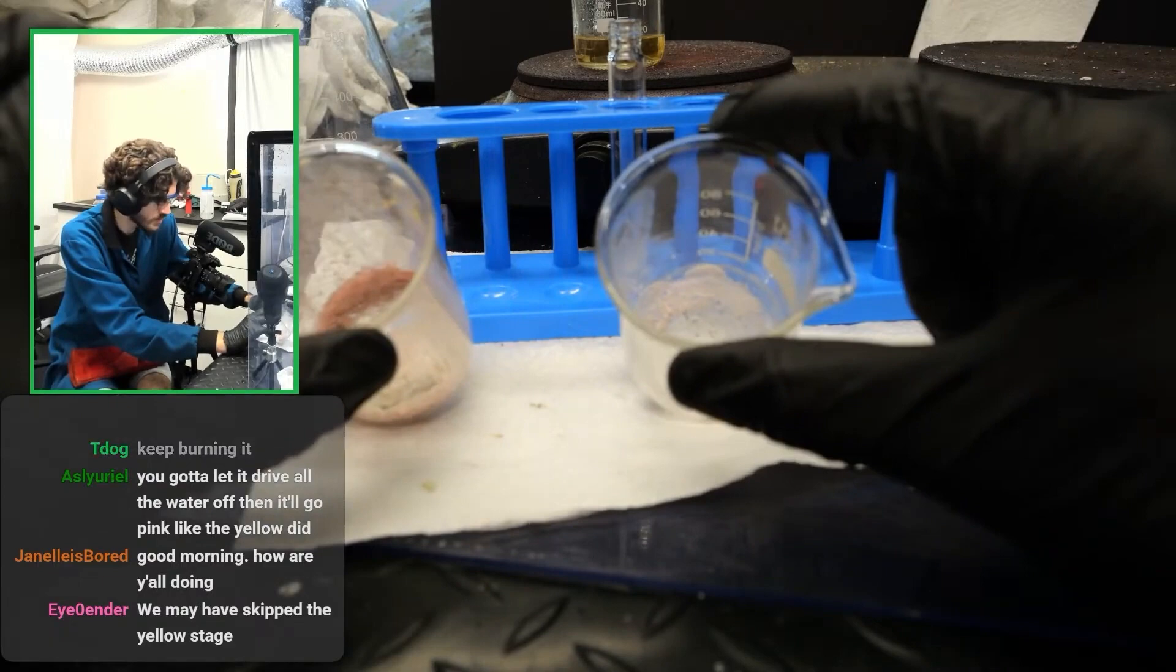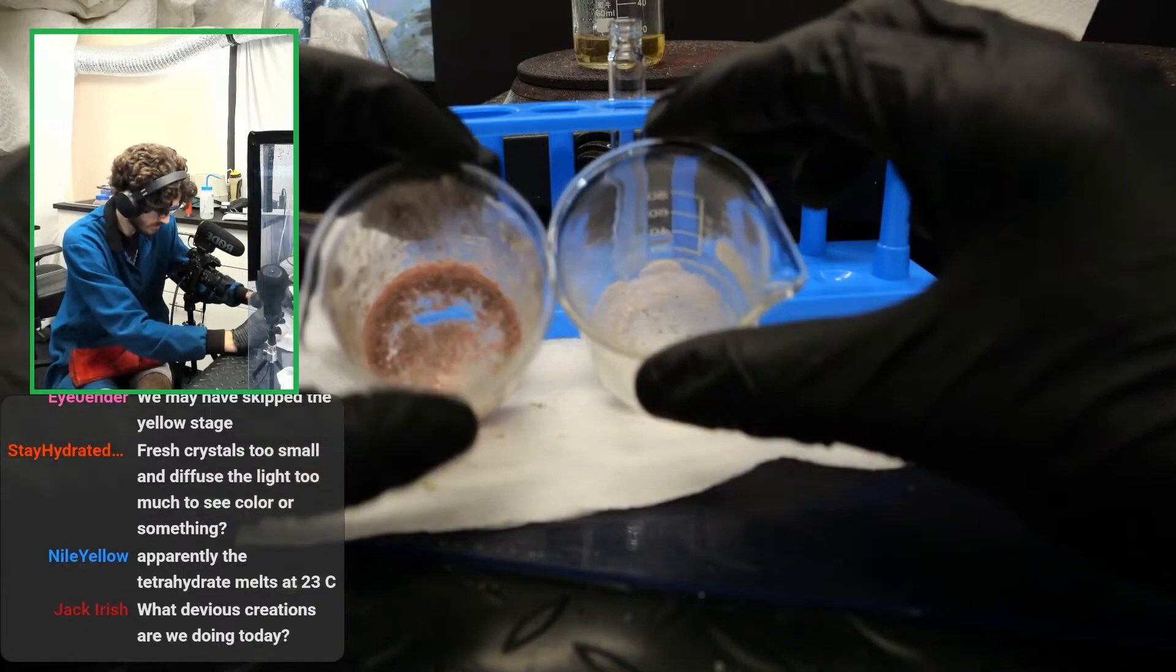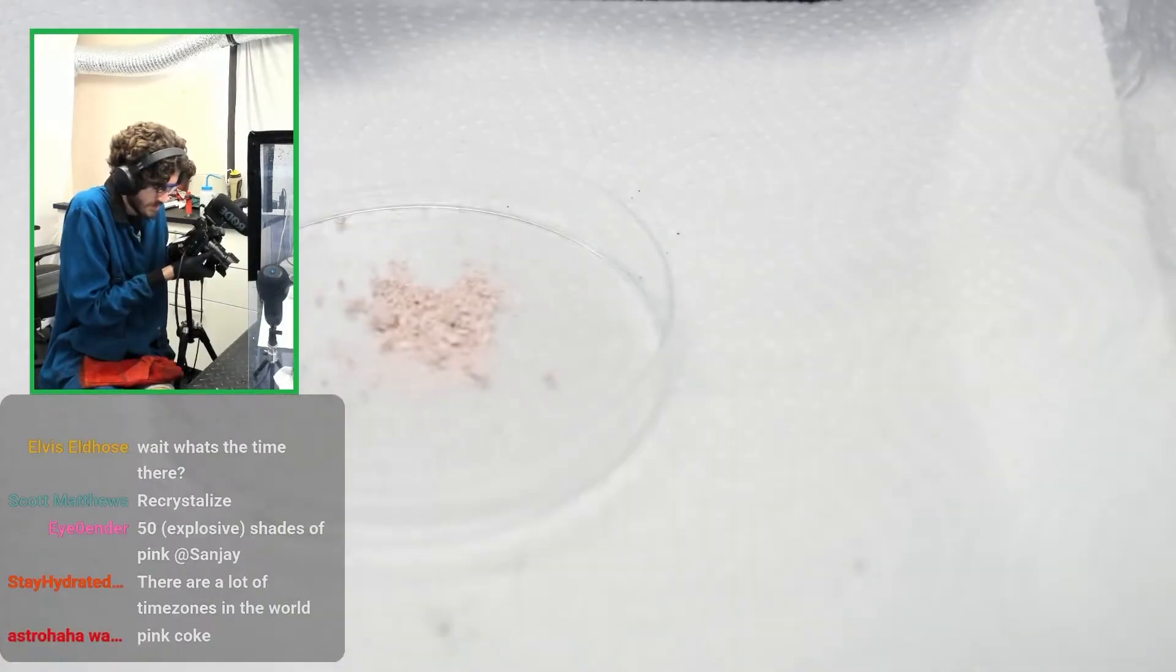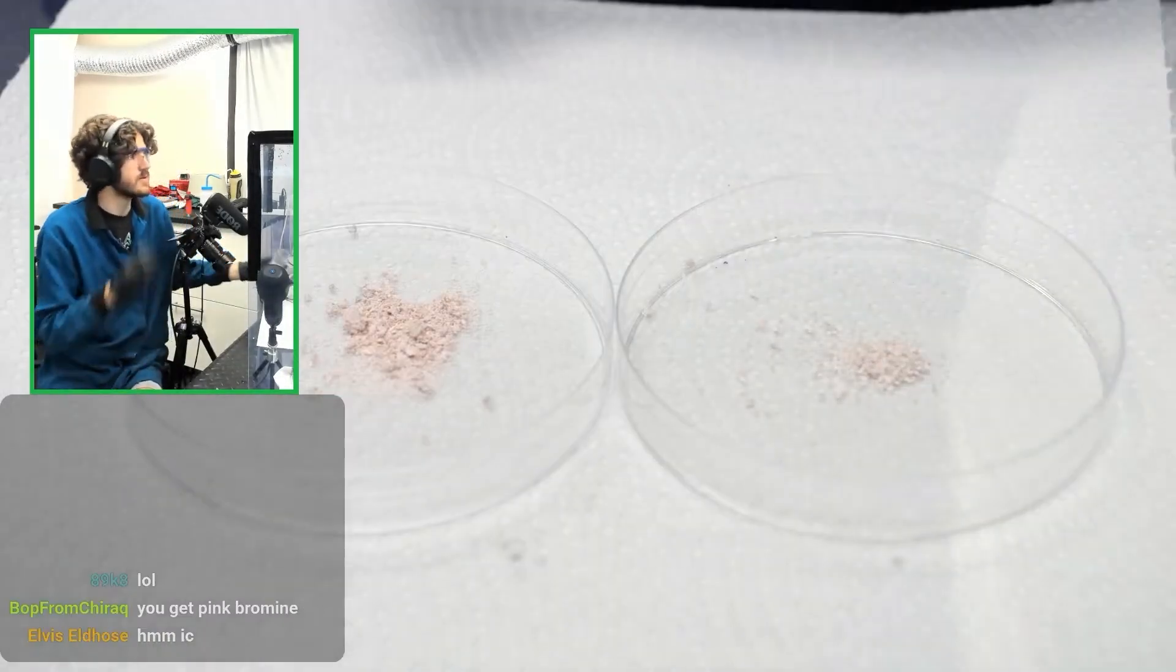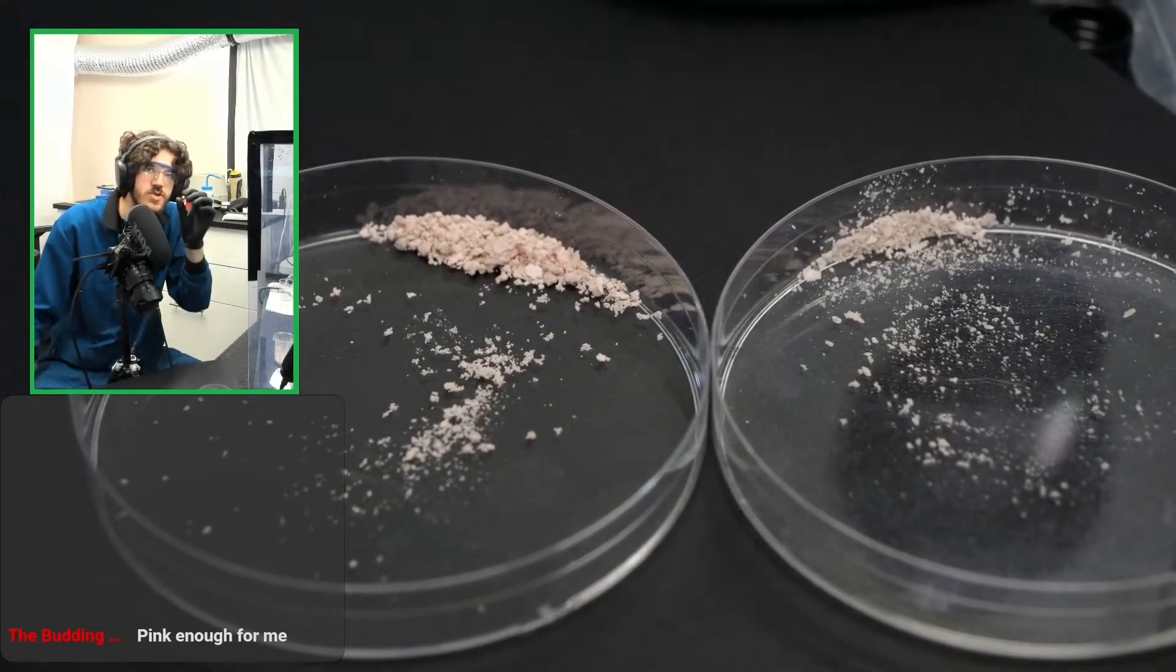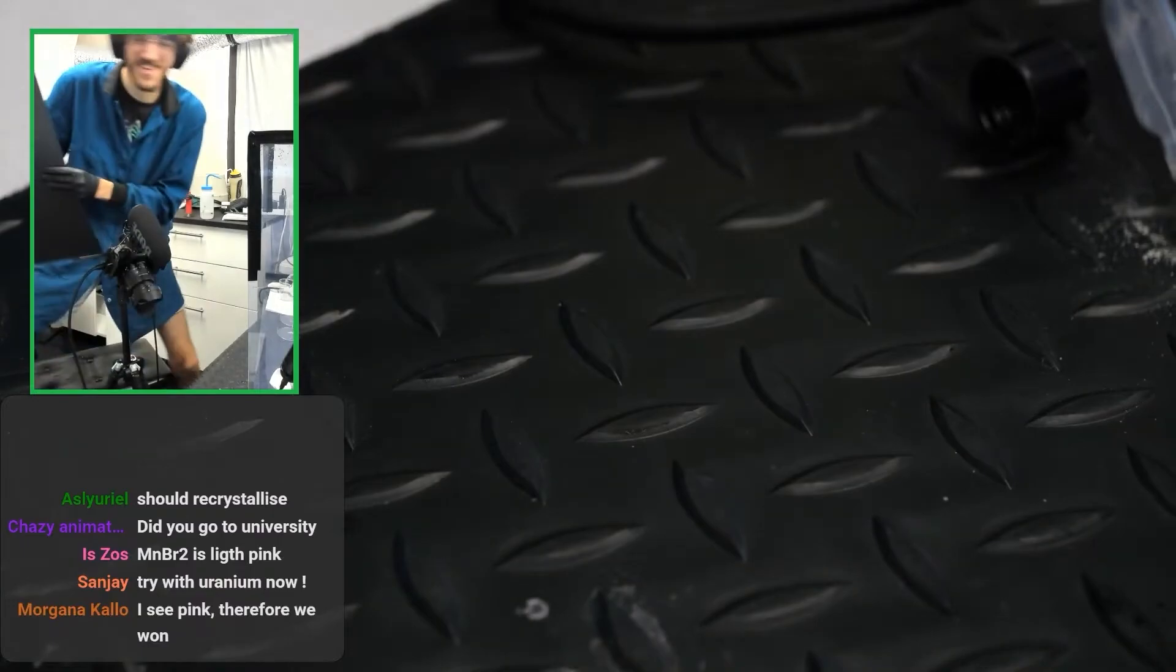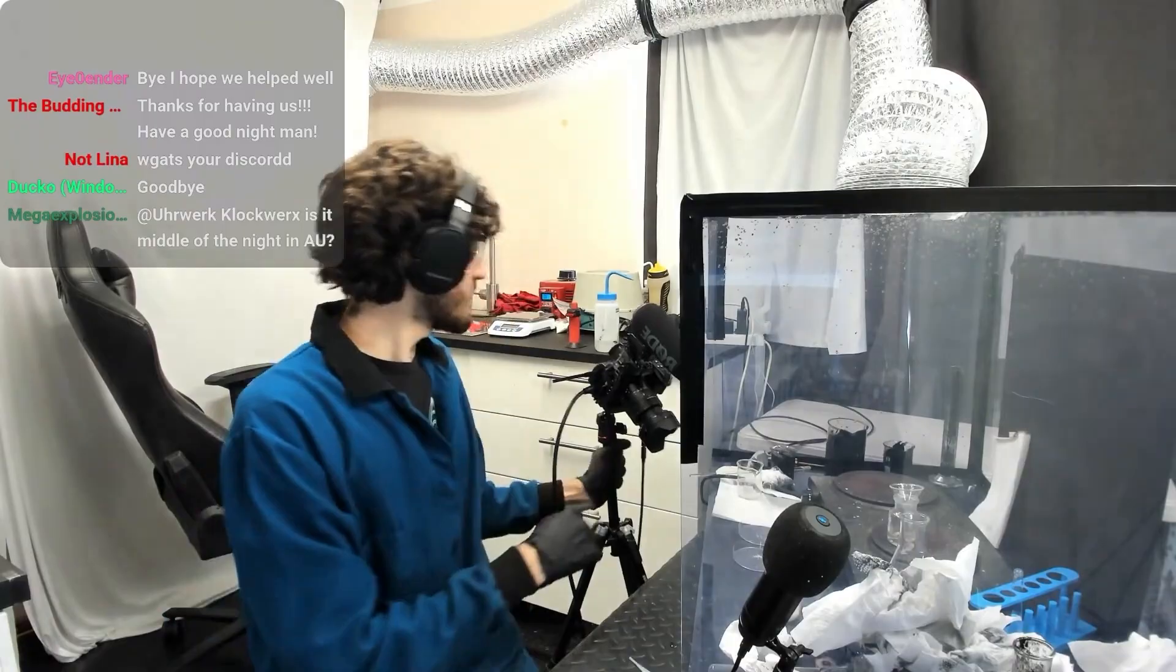Let's compare the two. Manganese chloride is on the left here and manganese sulfate is on the right. One is a lot pinker than the other. I'm happy that we've got our crystals. Okay. So this is the manganese chloride. Yeah. So that's that. And I'm going to compare it on the right to our manganese sulfate. Oh, I kind of like the manganese sulfate more. That is, if it is sulfate, it might be chloride, just more pure. Yeah. It'd be better if these were like actual crystal crystals that you can see through and are clear, but yeah, we did it. If you guys ever want to make pink crystals, that's how to do it. All you got to do is just completely destroy everything. But yeah, I hope you guys liked it. I'm going to clean all this garbage up.